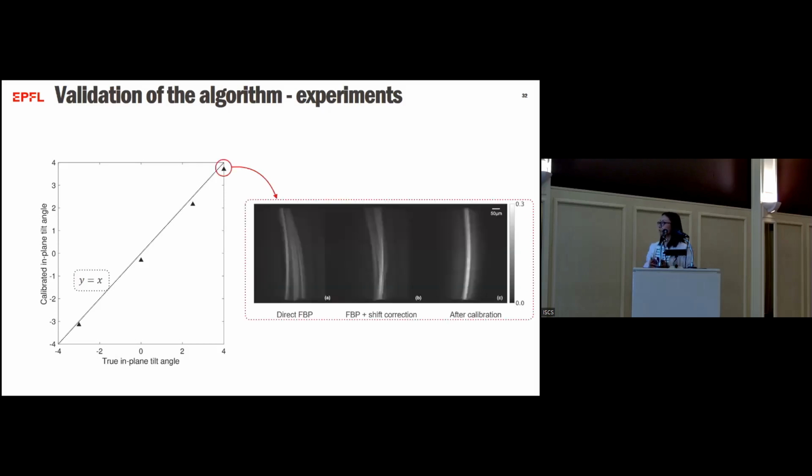Here's a reconstruction image in the case of a 4 degree tilt angle. When we apply direct FBP, we see many ghost shadows. And when we do a shift correction, we already mitigate some of the artifacts, but we still see it's not perfect. Then we apply our calibration, we manage to remove these artifacts.